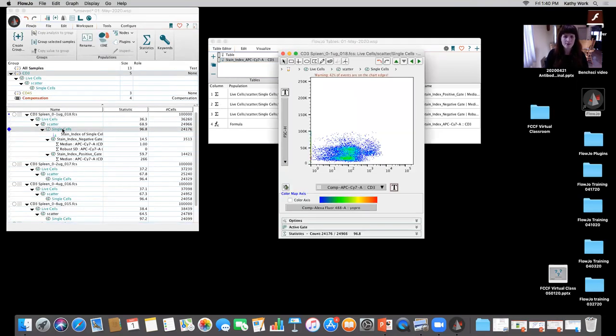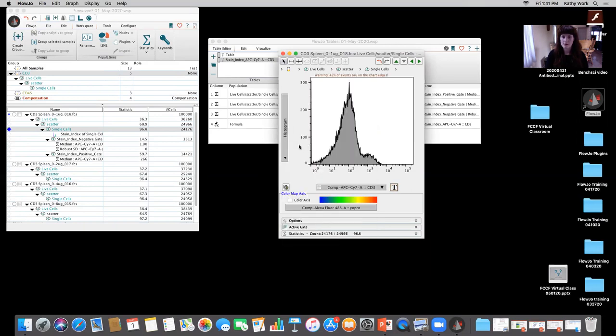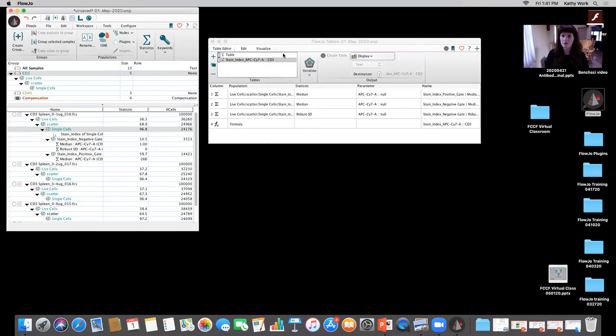But if I open up the single cells now, you can see, all right, I have CD3, I don't see any gates. That's because it does it based off of a histogram. So if I start typing in histogram based on the, when I go to change the y-axis, oh, I made a mistake actually. This is a really good troubleshooting example. I didn't choose the comp of CD3, so it's not going to choose the correct one because it was in a multicolor.